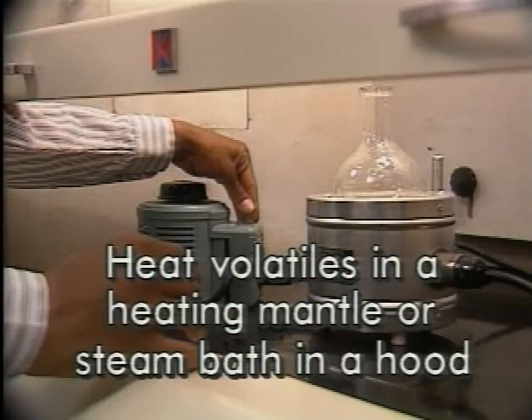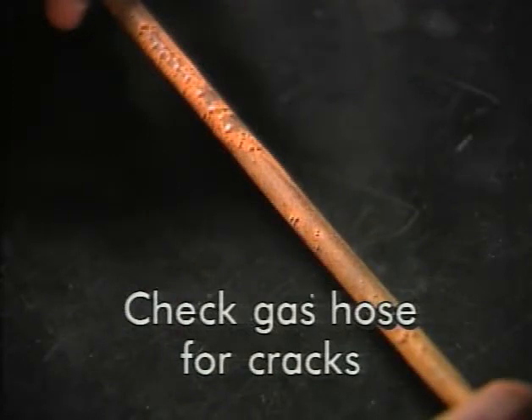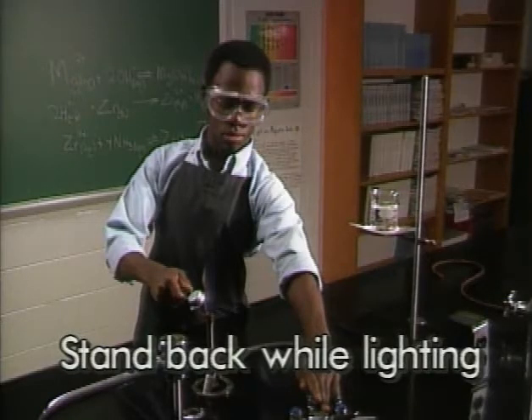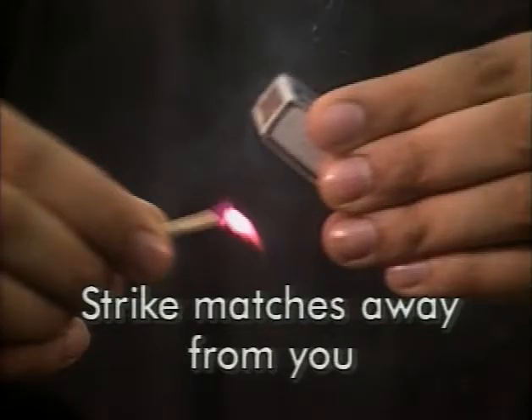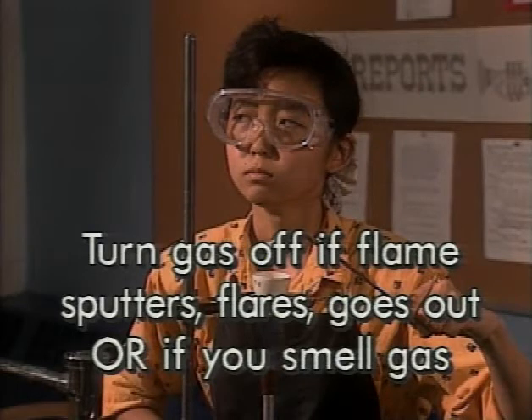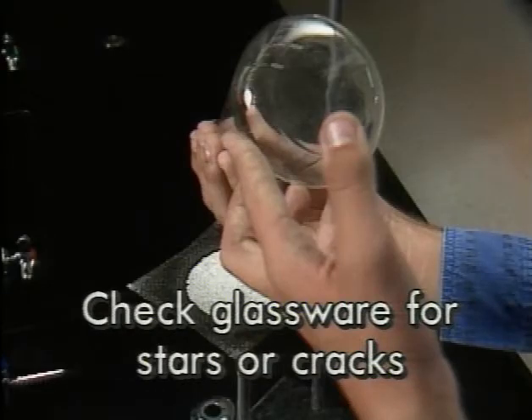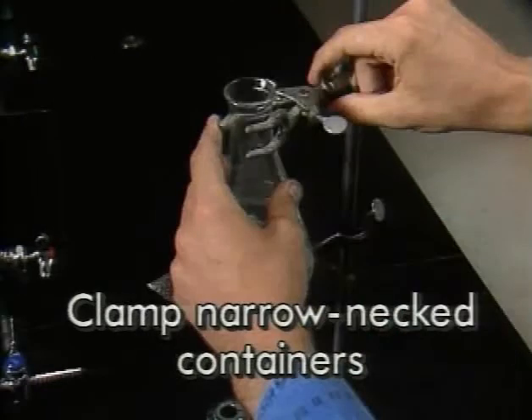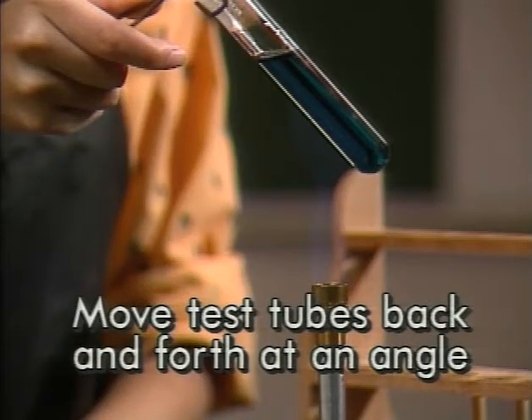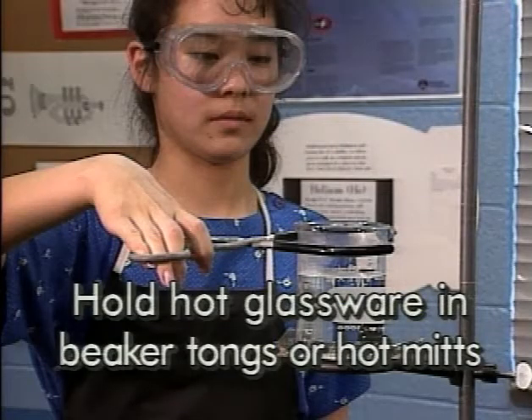Bunsen burner safety summary: heat volatile organics in a heating mantle or steam bath in a hood, not over a Bunsen burner; check the gas hose for cracks; make sure the hose fits securely; stand back while lighting; strike matches away from you; turn on the gas after lighting the match; turn the gas off immediately if the flame sputters, flares, goes out, or if you smell gas; check glassware for stars or cracks; clamp narrow-necked containers to the ring stand; move test tubes back and forth at an angle while heating; don't heat closed containers; hold hot glassware in beaker tongs or hot mitts.